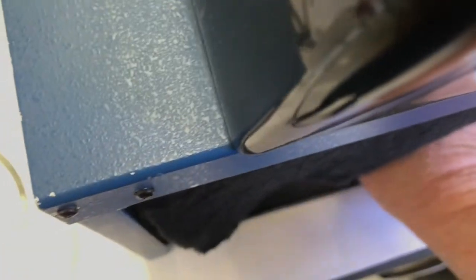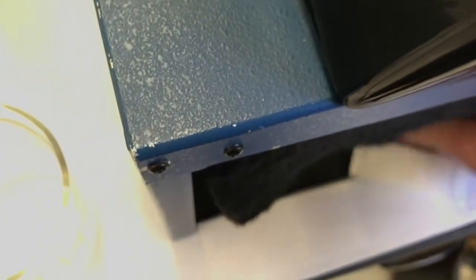So all we have to do is just wait a little while, let it evaporate a little longer when you have the solvent toluene. Because the boiling point of toluene is about 110 degrees Celsius, so we just have to do a little more shakes.